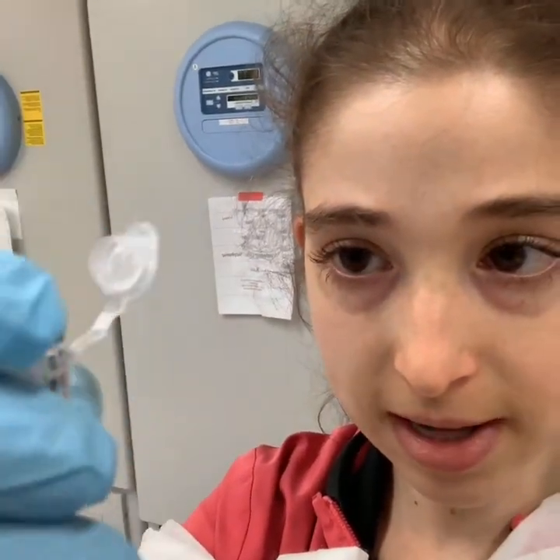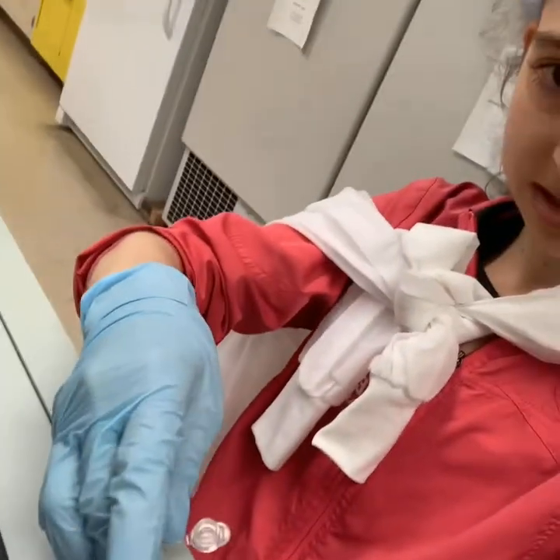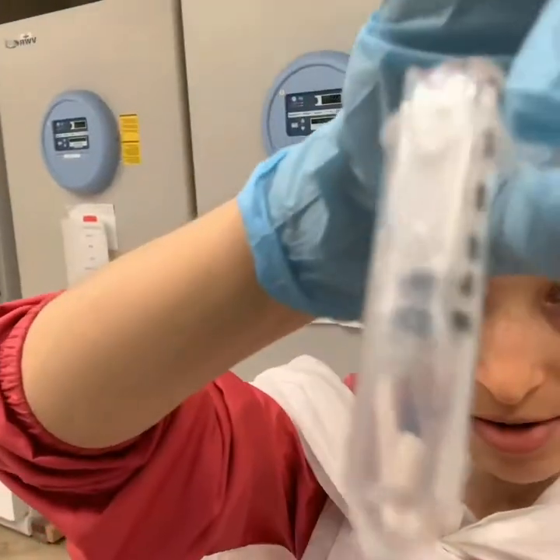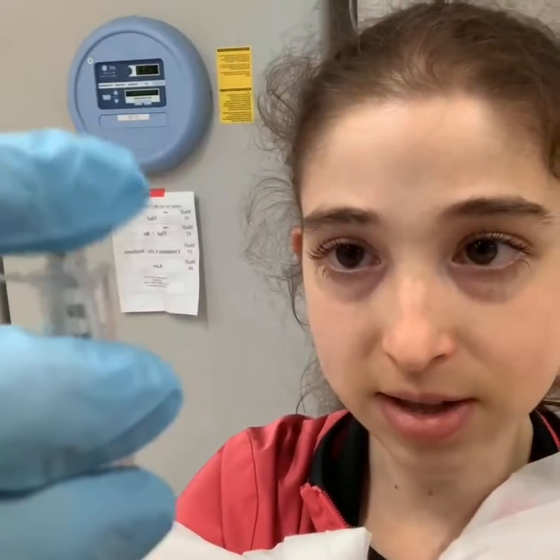With the smaller ones and some other brands, you concentrate it and then to get full recovery — because it's so small — after you concentrate it, you put it in a new tube upside down and spin it slower, and that sucks the liquid out. That way you make sure you recover it all.